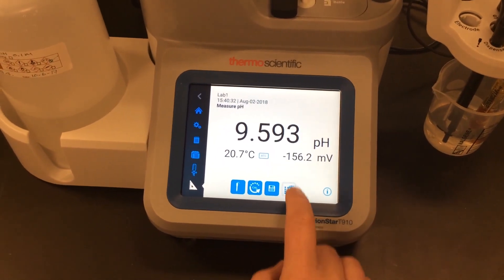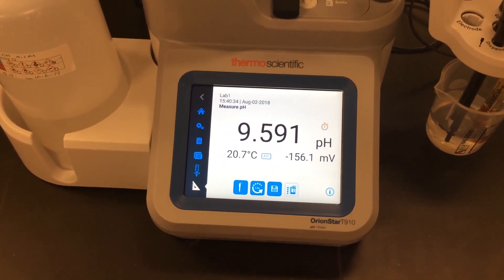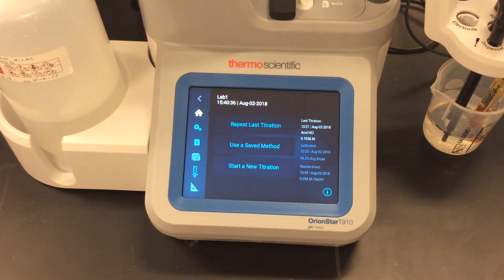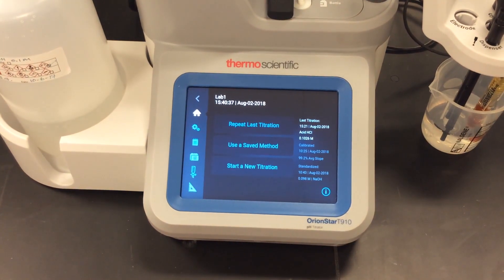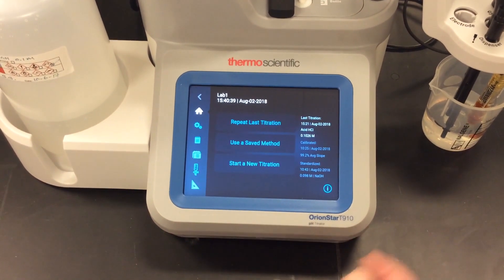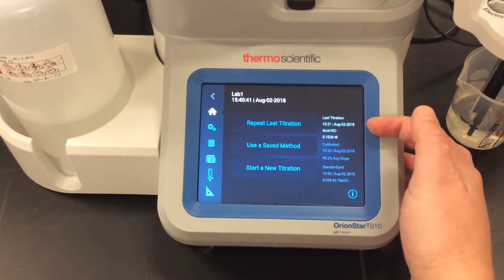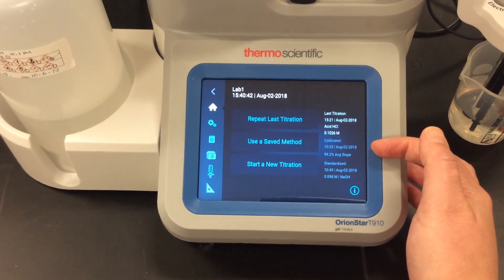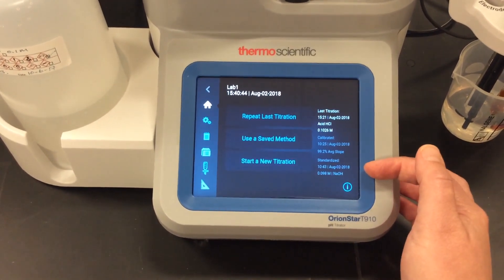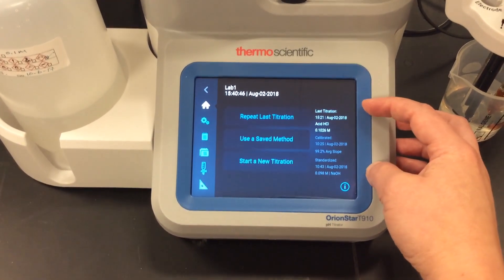I can start and stop the stirring probe, and if my stirring probe is not running at the speed I want, I can press and hold this button and adjust the speed right from the screen. On my home screen I can see my last titration data, my calibration data, and my standardization data.